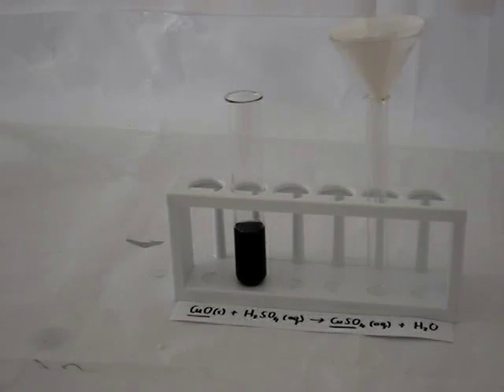Copper sulfate is a blue substance, and although we can't really see very nicely that it's formed a blue substance yet, we'll give it a little bit of time.